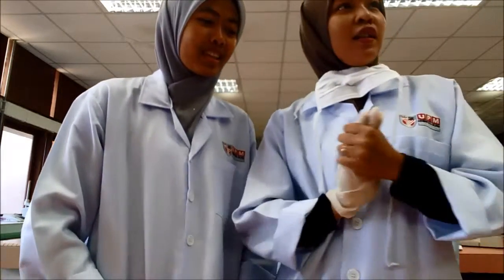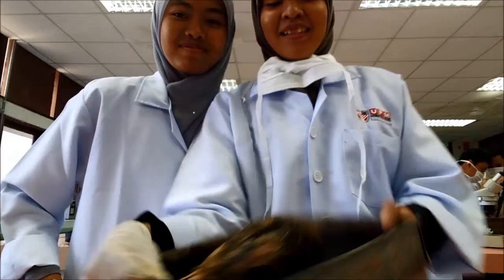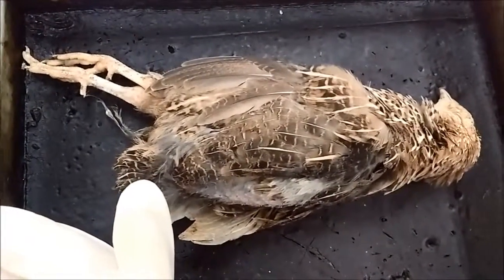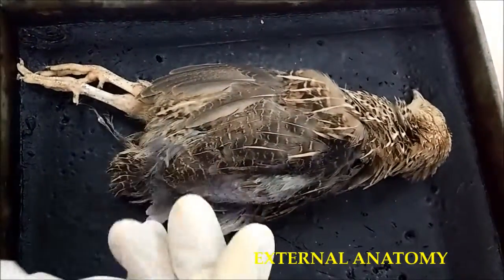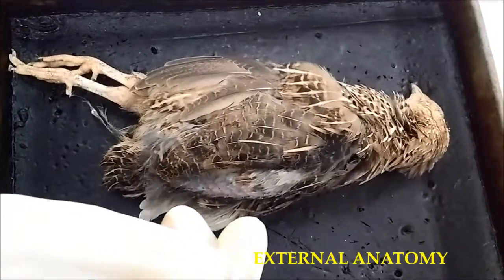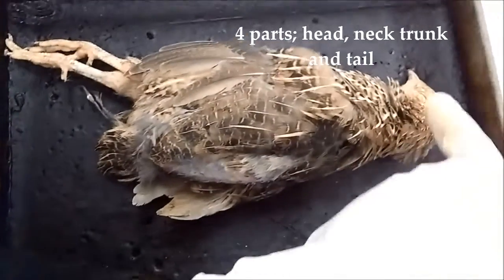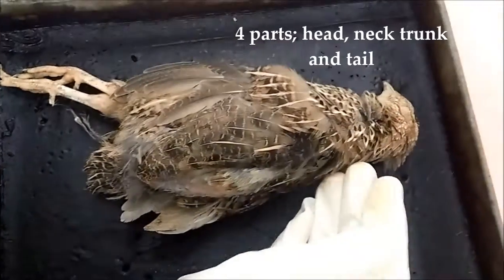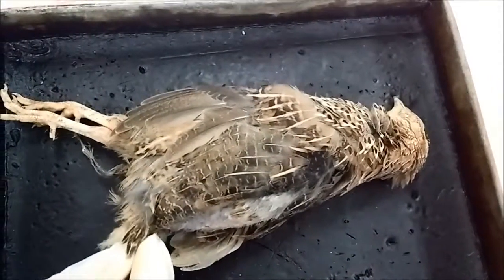So basically, first things first, we have a bird here. Firstly, we are going to observe the external anatomy of the bird. So basically, this is the bird. The external anatomy of a bird is divided into 4 parts, which are the head here, the neck, the trunk, and the tail. This is the tail of the bird.